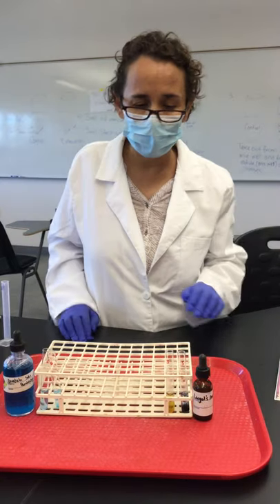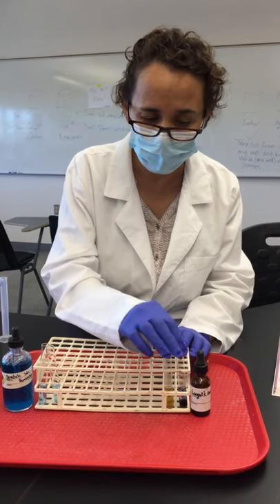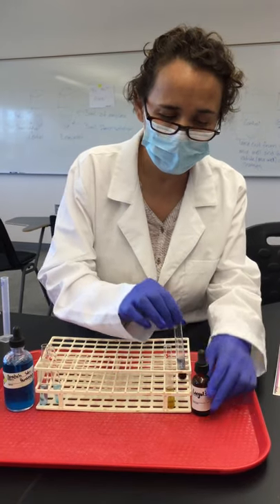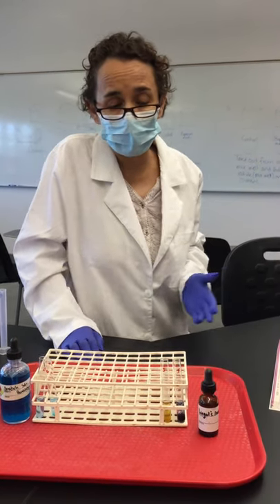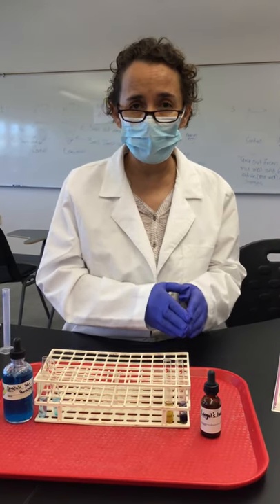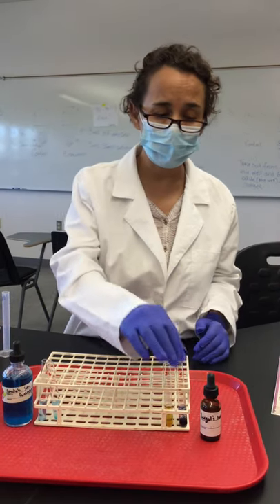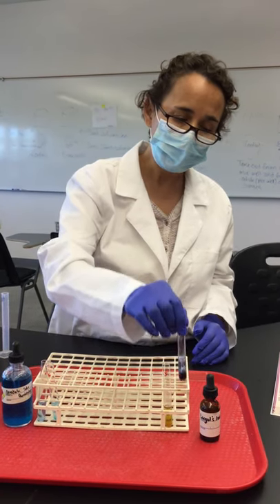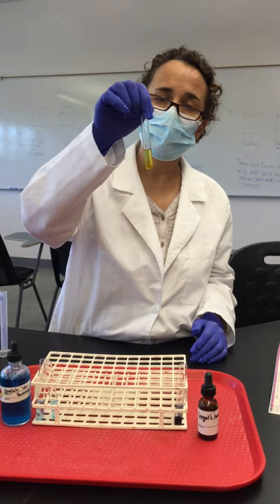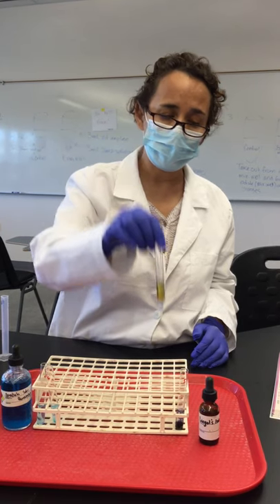We added the same amount of Lugol solution to tubes 3 and 5. The Lugol solution is an iodide solution that detects the presence of starch. When starch or undigested carbohydrates are present, you get a dark blue color. When you see a yellow color, that means the starch has been digested.